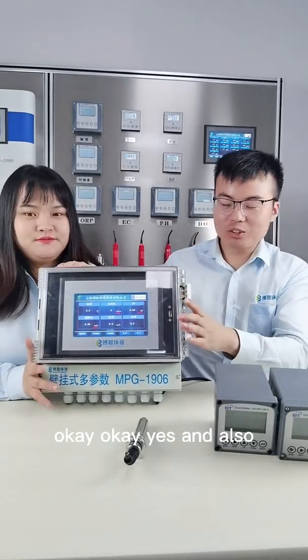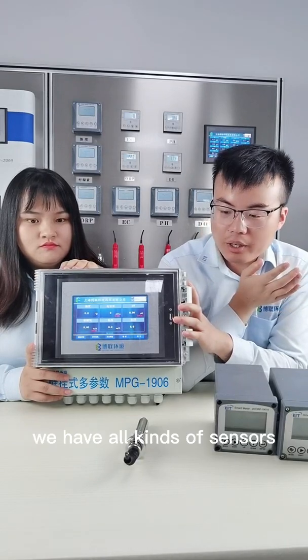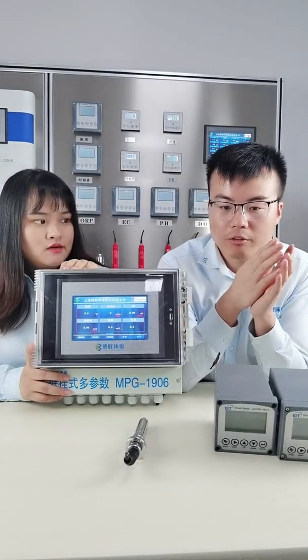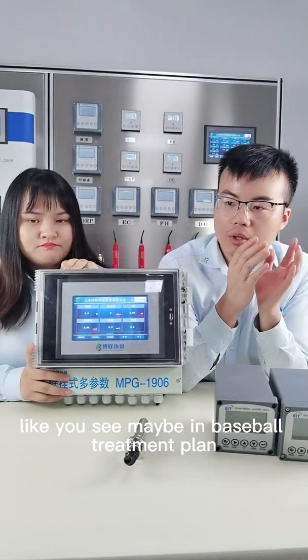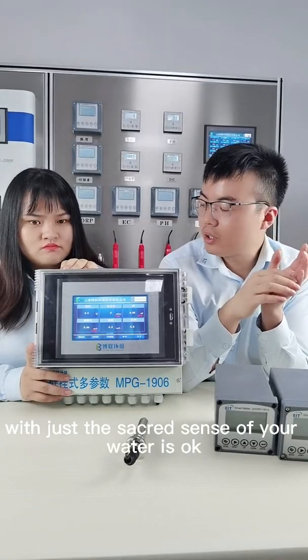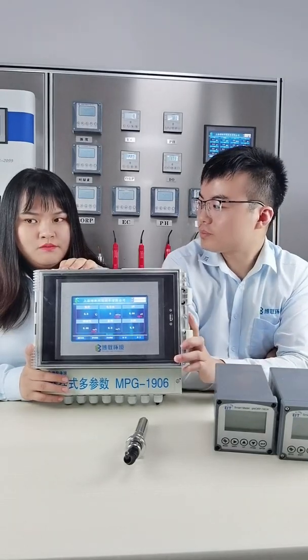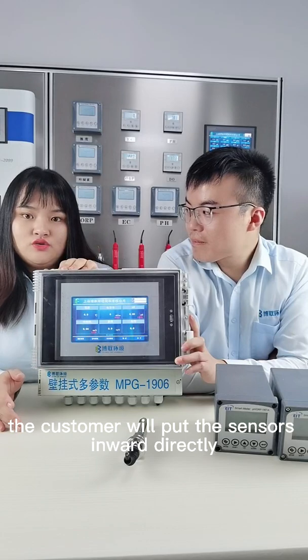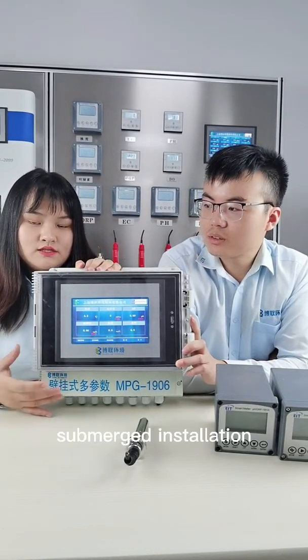Yes. And also, one more thing is about installation, because we have all kinds of sensors that can integrate with this product, so it will involve installation, because it is sensor type. Like you say, maybe in a wastewater treatment plant, we just put the sensor into the water, okay. And how about the fish farm aquaculture area? In most situations, the customer will put the sensors into the water directly, which means a submerged installation.